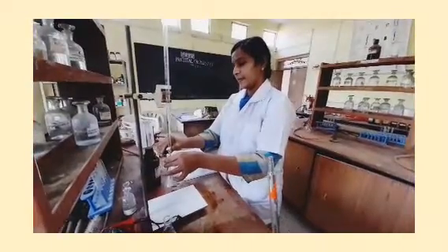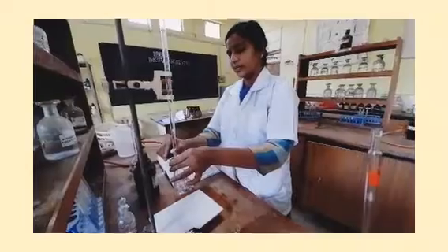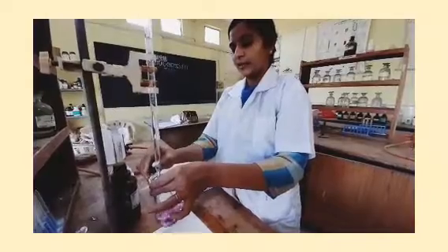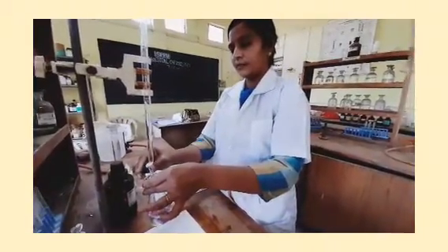Now I titrate this conical flask immediately with the 0.1 normal NaOH. With each addition, I stir or shake the solution vigorously because I need to find out the end point of the reaction. The first reading is known as the T0 reading. After this reading is completed, we will conduct the second reading after 5 minutes, depending on the observation table. In another type of experiment it may be conducted after 10 minutes — it depends on our choice — but the difference between two readings should be constant.